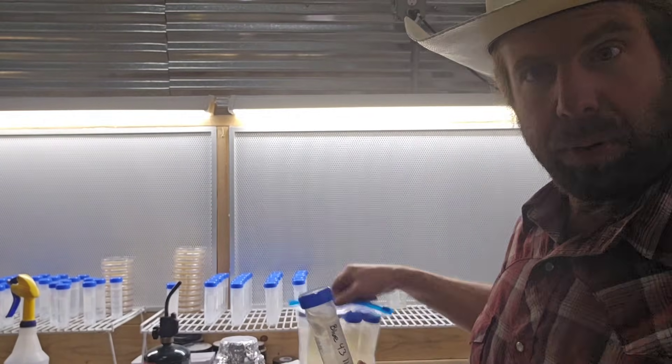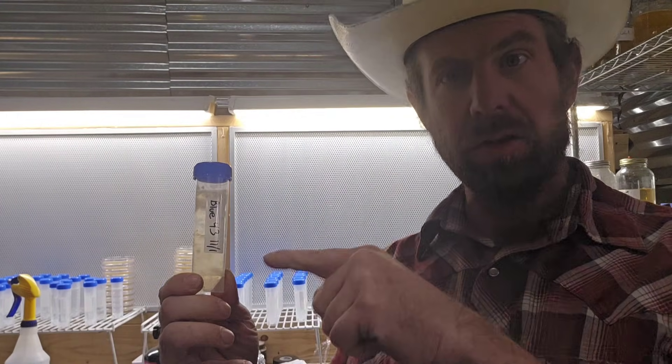After I make them, I put them in a ziploc bag and then in a tote in my refrigeration — in my walk-in cooler. You can also wrap parafilm around the top of these, but I just keep mine in the ziploc baggie. When I ship them I'll wrap them so they'll be totally sealed, but these caps have a very good seal. If you want to make some of these yourself, I got them on Amazon — they're self-standing sterile 50 milliliter centrifuge tubes.